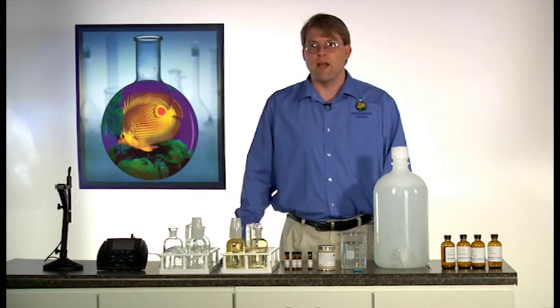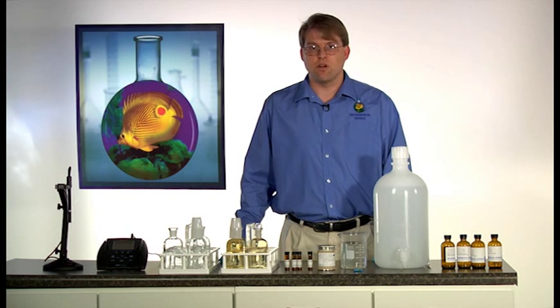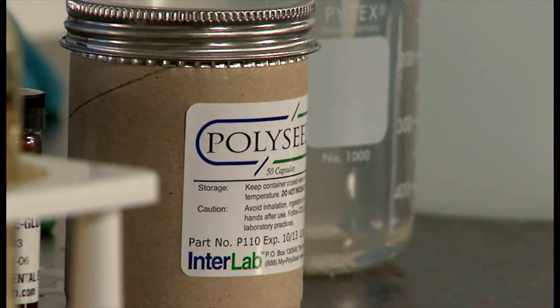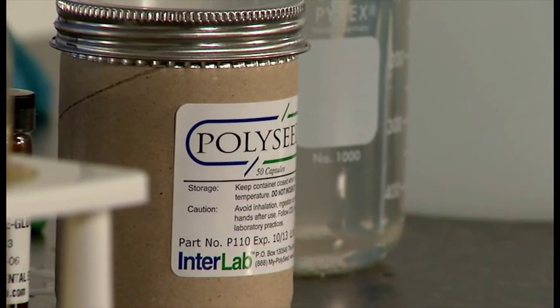Stir or aerate the seed for one hour. After the seed has stirred for an hour, allow the bran to settle and decant the liquid from the top. Your seed solution is now ready for addition to your sample bottles.